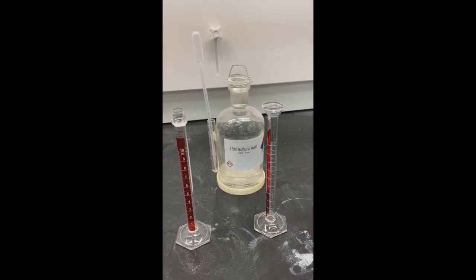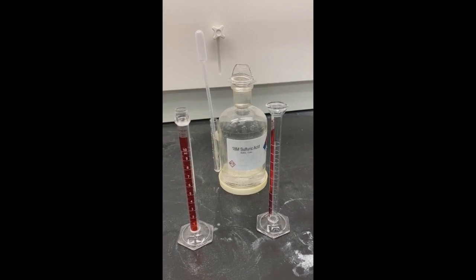Since I have the advantage of having as many graduated cylinders as I want, I'm going to get those ready to go. These acids are in the hoods.